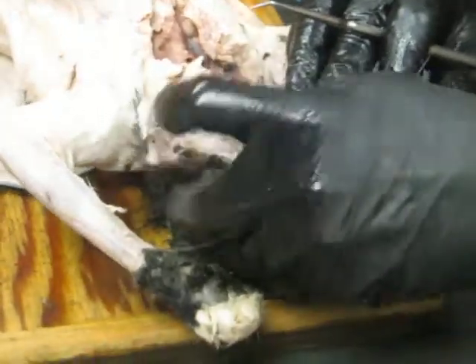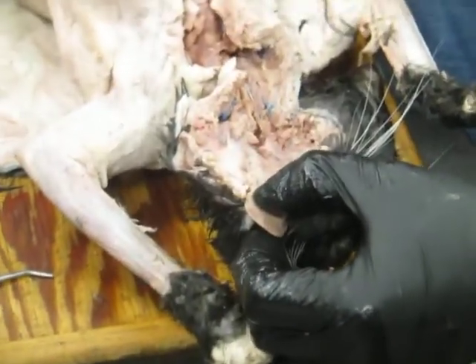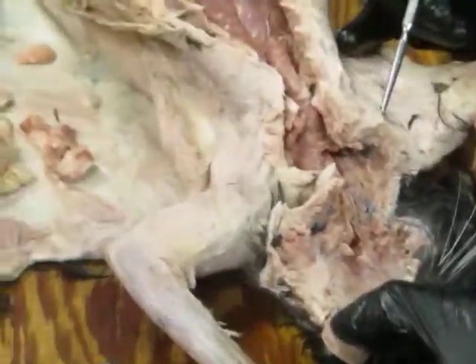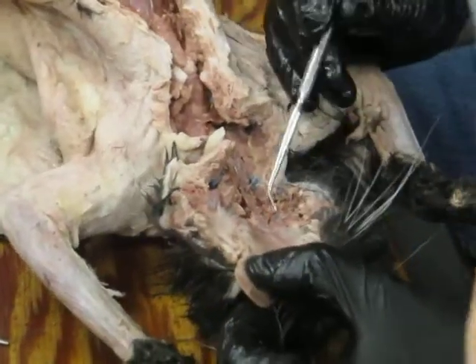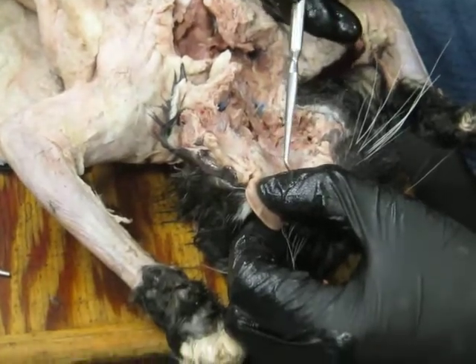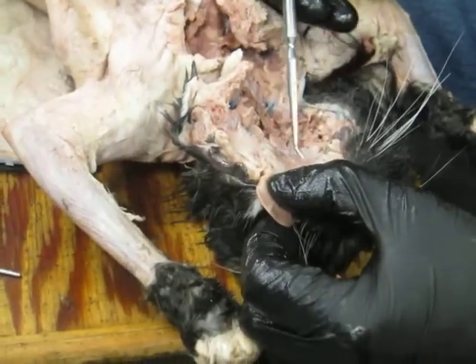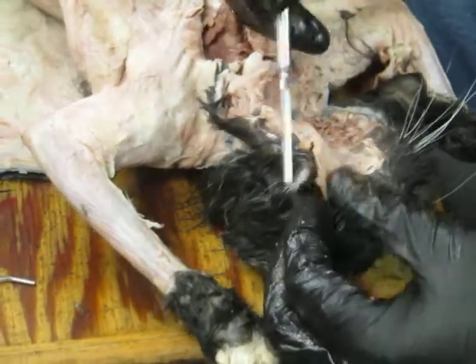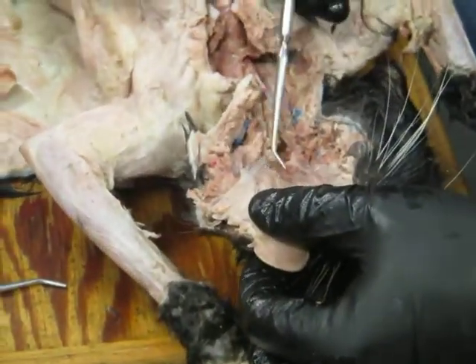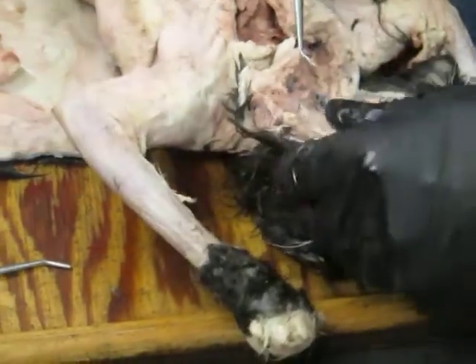Okay. So these guys have opened up the oral cavity. So here's the oral cavity. If you can't see, let people know and make sure you can come in, because this is a little smaller, and I know this is something a lot of people haven't really seen much yet. This is the hard palate. You can feel there's something hard there. And if I keep moving back, then it becomes the soft palate. Okay. Here's the tongue on the floor of the mouth. And there's papillae on the tongue, very cool. Filiform papillae and such.